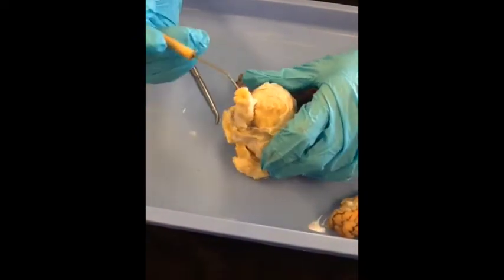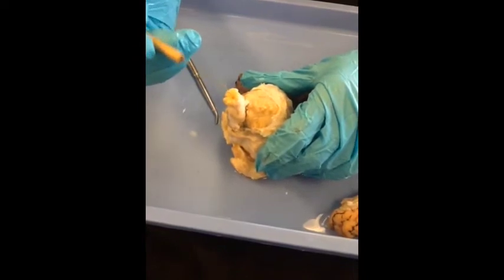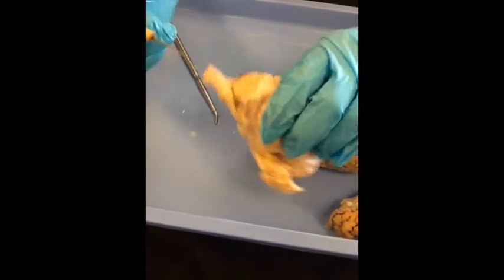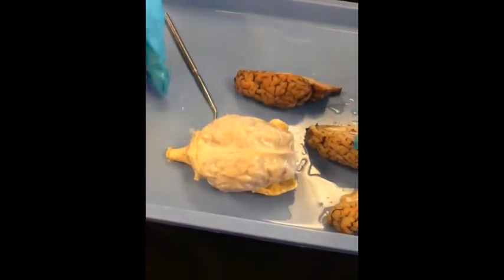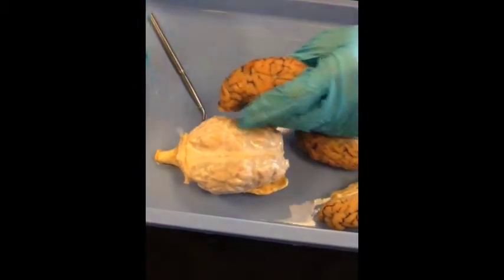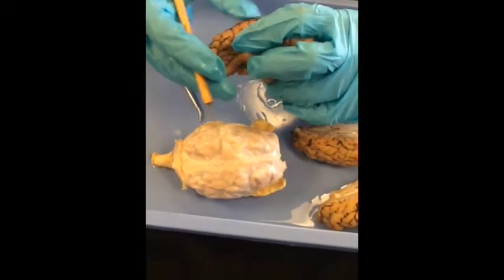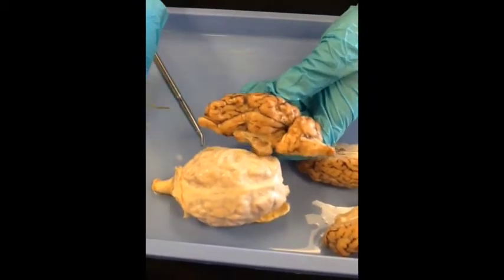Here you do have your spinal cord, so the very end of this is the spinal cord. Once you get the dura off, you can look at some of these external structures.